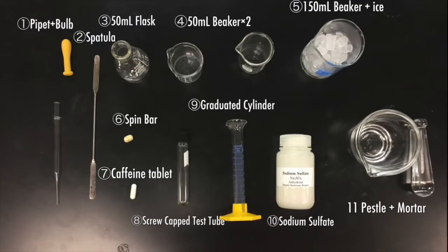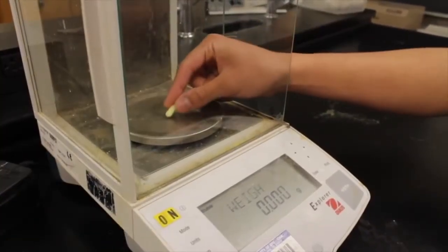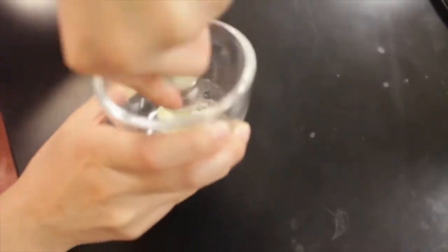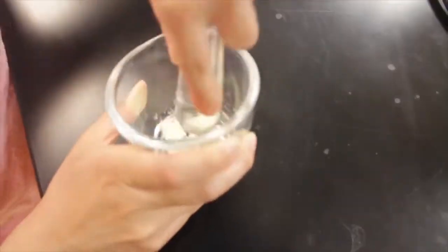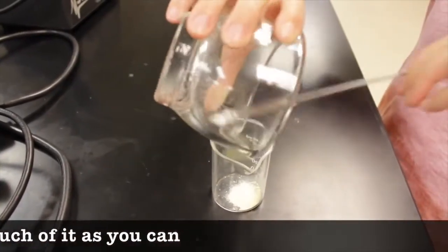These are the materials you'll need for this lab. Weigh and record the mass of your caffeine tablet. Using the mortar and pestle, crush the caffeine tablet into a fine powder. Transfer as much of the powder as possible into a 50 milliliter beaker.